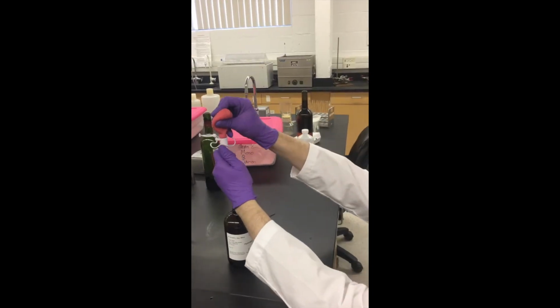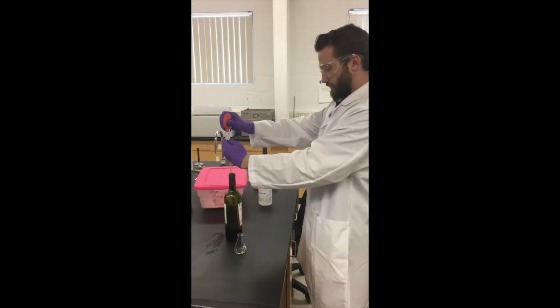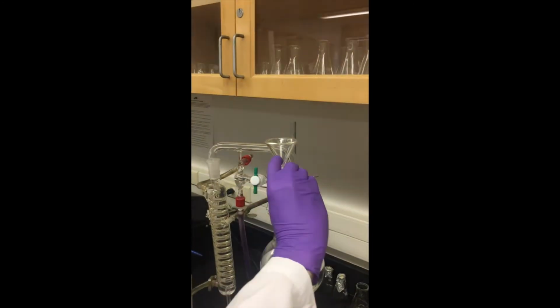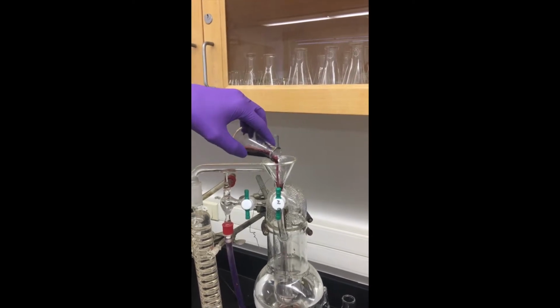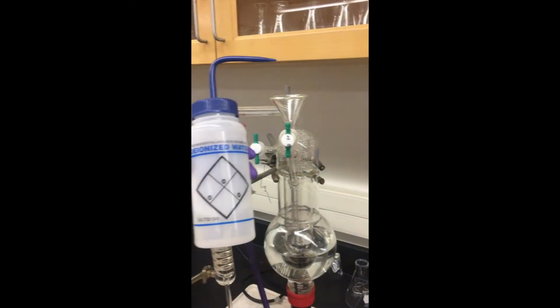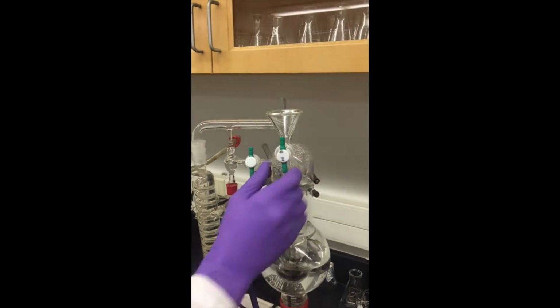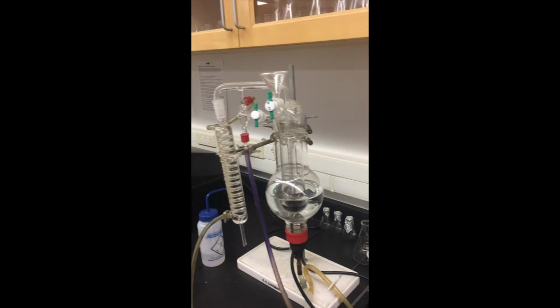To prepare your sample, measure 1 milliliter of 0.3% hydrogen peroxide. Then measure 10 milliliters of the wine you are testing and add to the same flask. Making sure that the stopcock is indicated for the inner sample chamber, add your 11 milliliters of sample into the top funnel. Rinse with DI water to ensure all the sample is in the sample chamber. Then turn your stopcock to the outer sample chamber and turn on heating element.